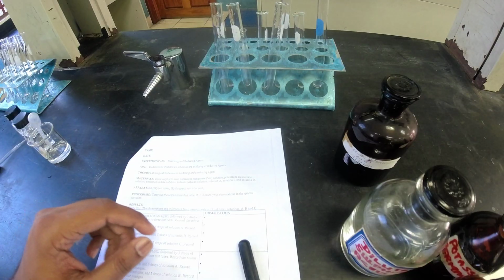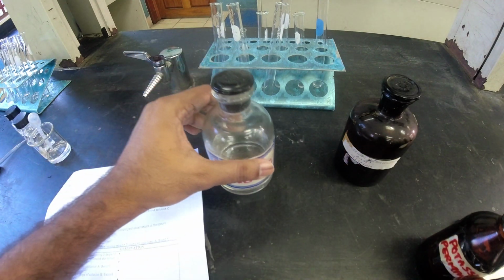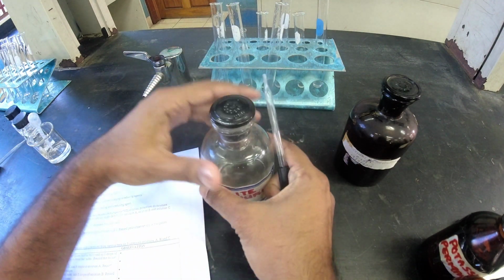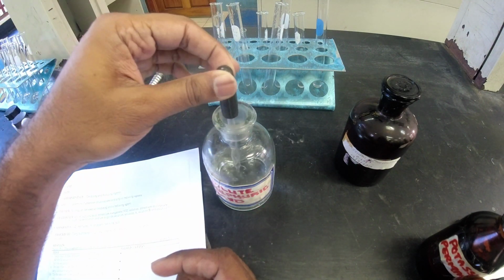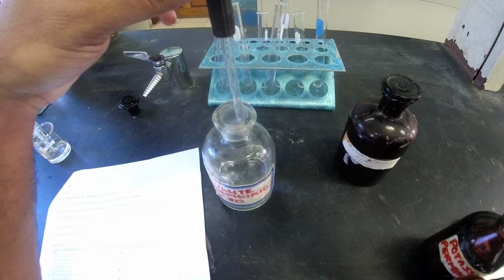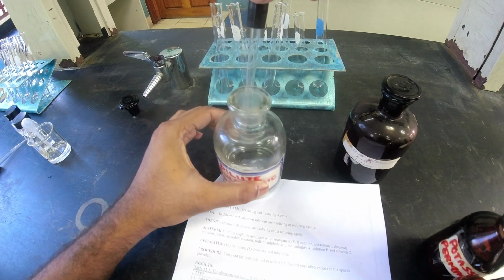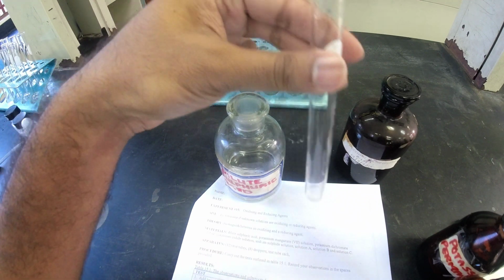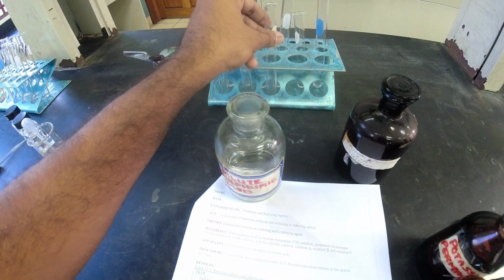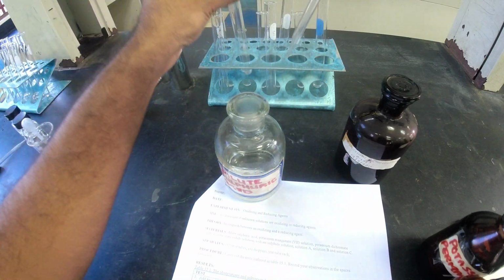Alright guys, so first things first, now normally you're supposed to have on gloves, but seeing that it is dilute sulfuric acid, I will take the chance. It shouldn't do anything to me, and I'm not interacting with the chemical. So first thing, add 2 drops of, that's 1, 2 drops of sulfuric acid. That's for the 3 test tubes.